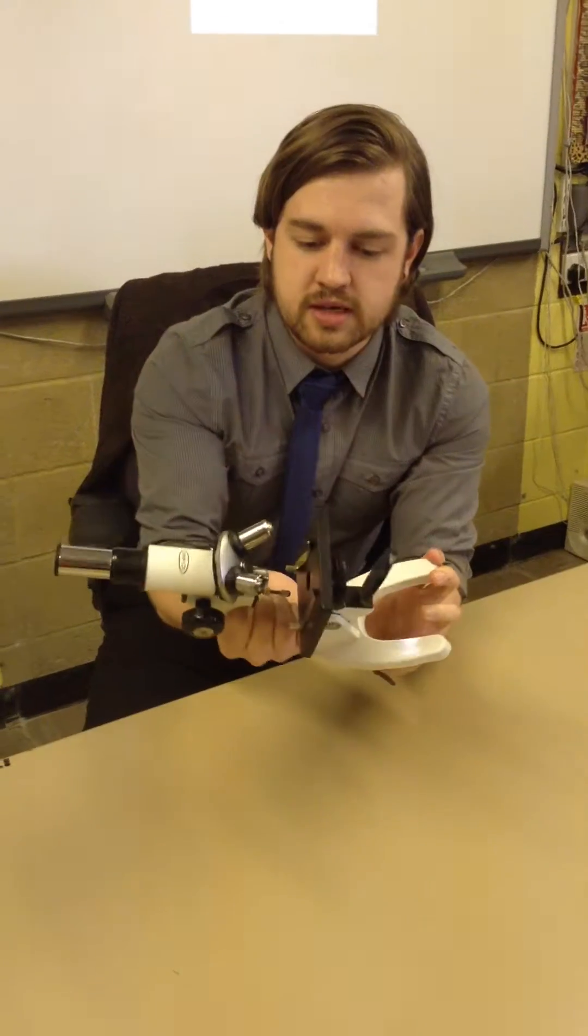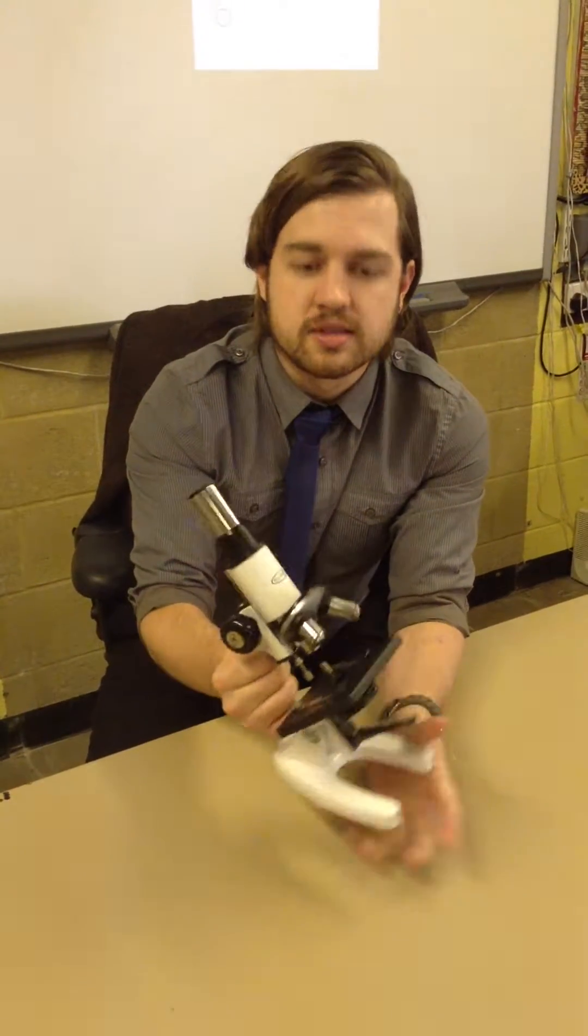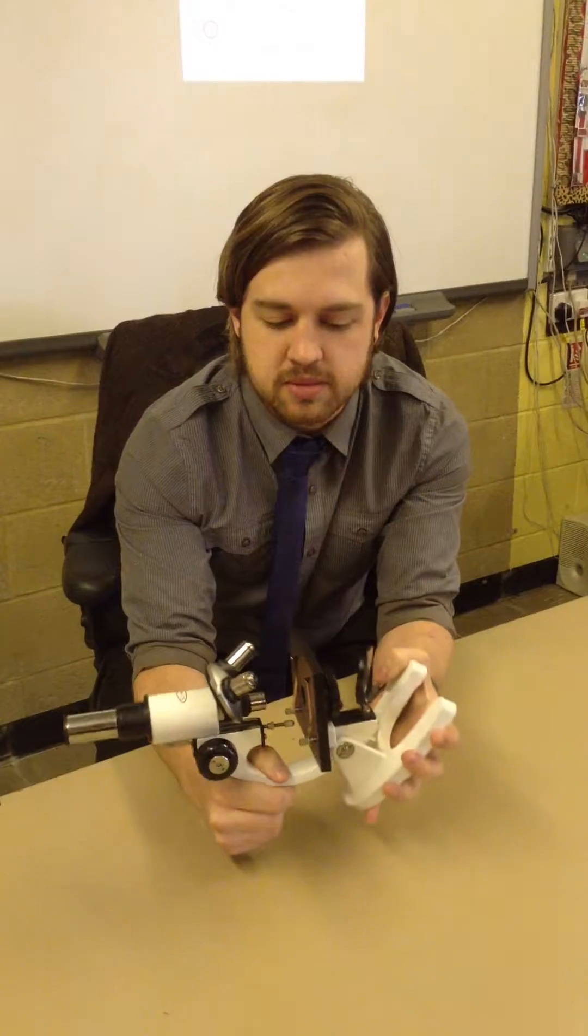The arm of the microscope is designed to bend and move, so you can use it to make yourself more comfortable when looking at the microscope.